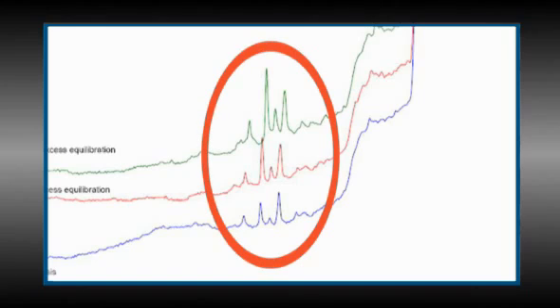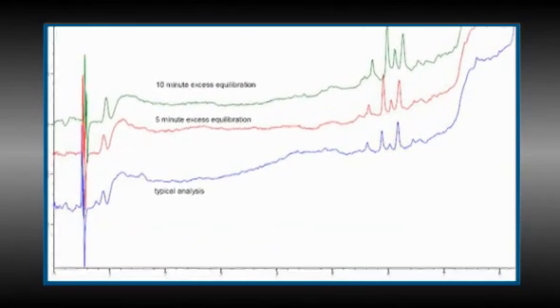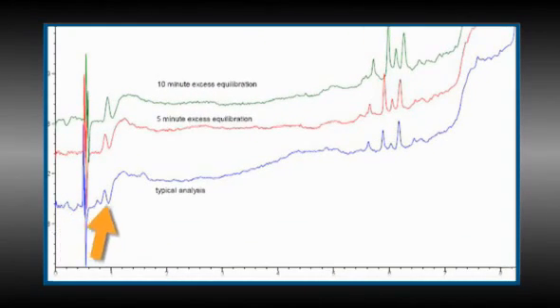These peaks could interfere with peaks of interest, and therefore we have to understand their source and figure out how to get rid of them. The bottom chromatogram, the blue one, represents the original gradient with its equilibration time of 10 minutes already established. One can see the evidence of 6 or so peaks with the respective peak heights or peak areas in the 5.5 to 6.2 minute time frame.